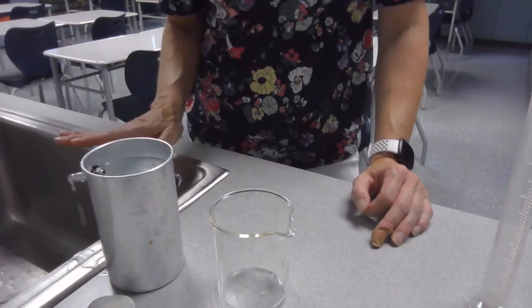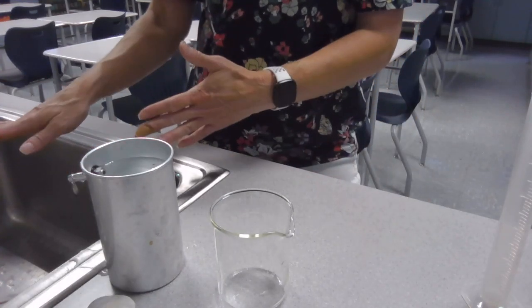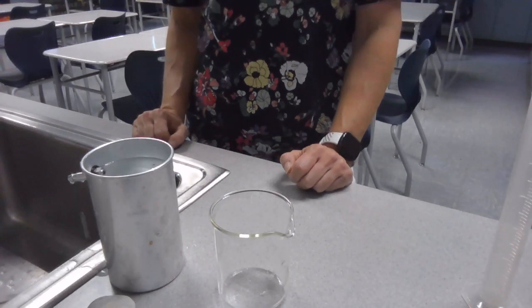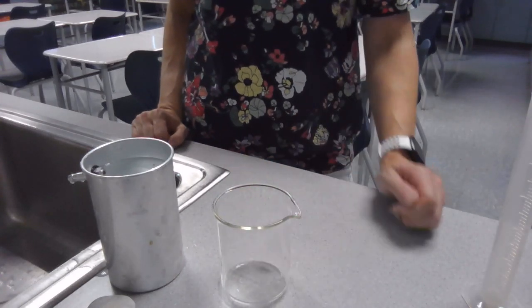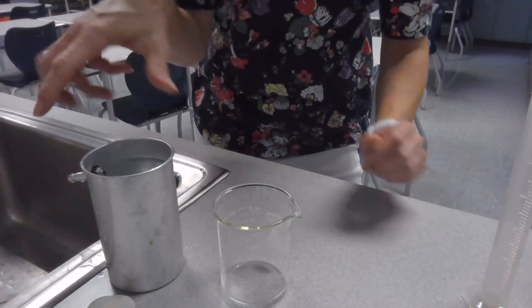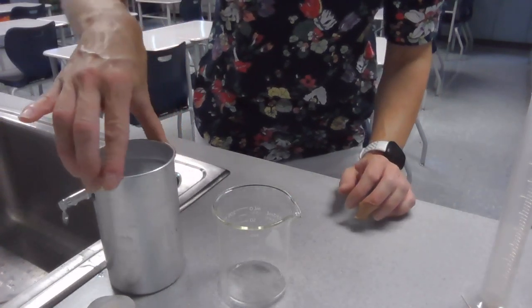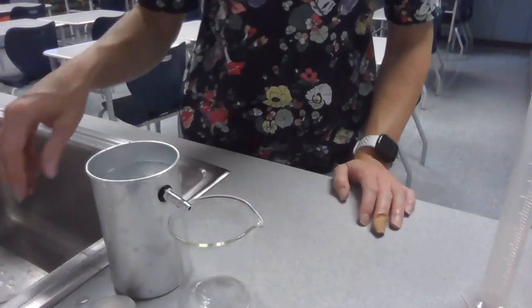This is going to take a little bit. You want to wait until the dripping stops, but keep it right on the edge of the sink so all the water goes right into the drain. So when the water is settled and the drips have stopped, you're going to very carefully turn it so that the spout is aimed towards an empty beaker.